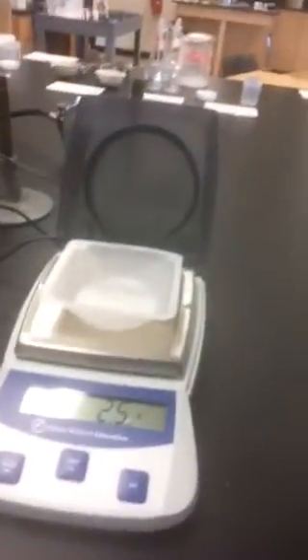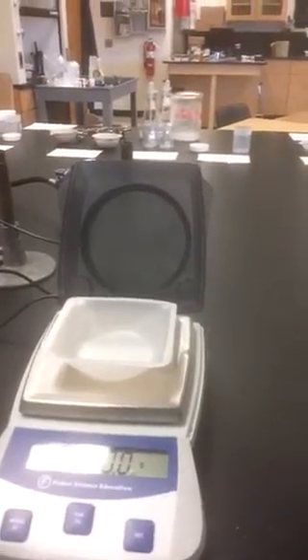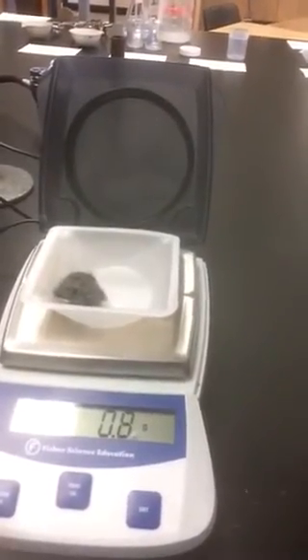We have a piece of steel wool in a weigh boat. We're not interested in the weigh boat, so we're going to place it on the balance and measure the mass of it. Now normally you would have to subtract it, but we can zero out the mass and place the steel wool on it. When we do this, we get 0.8 grams. Please record that in part 1 of your data table.